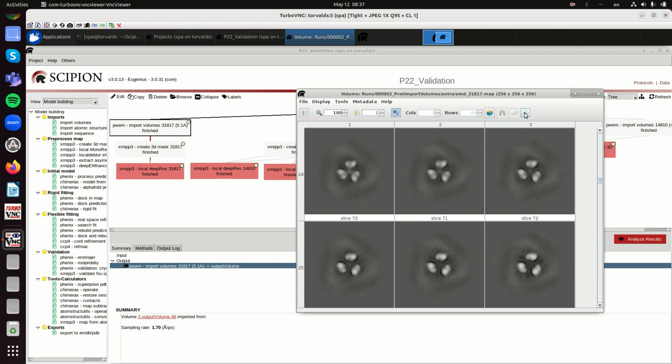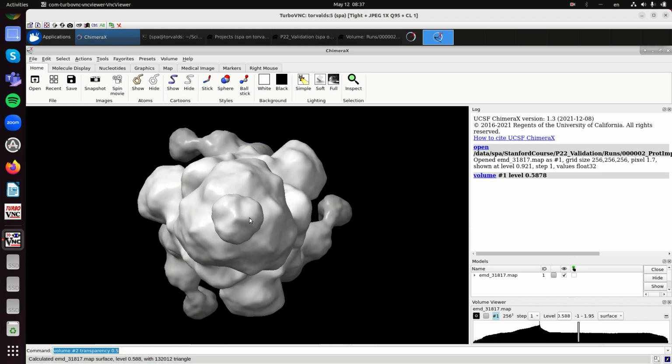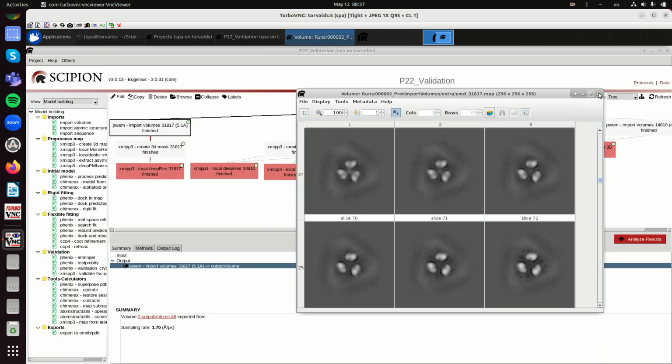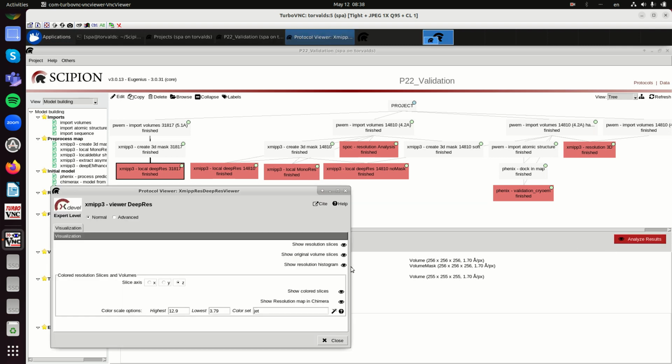So remember, FSC is when you repeat the process twice and you compare the two results. If you are very consistent in your processing, then your two structures will be consistent up to very high resolution. But this doesn't have 5.1 angstrom, even if the FSC declares that. Here we will use DeepRes, an algorithm based on neural networks. A protein structure at different resolutions has different properties. So it compares the properties of your map to the expected properties of a protein at that resolution, and then it assigns a resolution to every voxel.